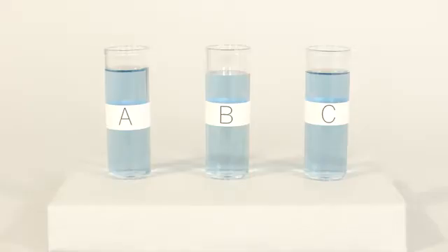First we start with three vials, each containing water and a chemical that tells us how much carbon dioxide is in the vials. The chemical's color will change according to the amount of carbon dioxide.